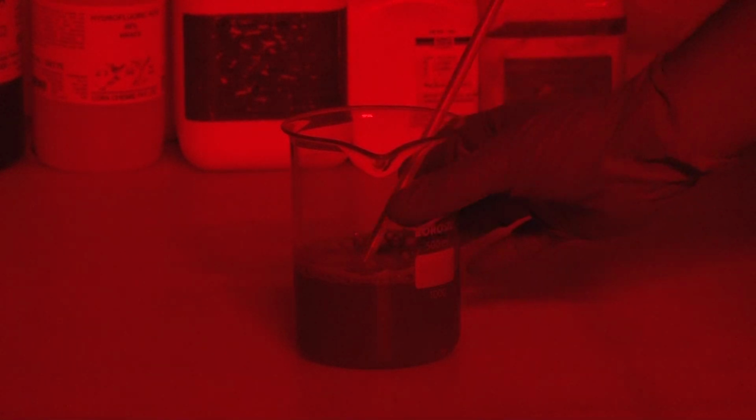You have to stir your sample after pouring the HCl. As long as your sample is giving effervescence, you have to keep it for a longer time. And when you cannot see effervescence coming out from the sample, that means all the carbonate has been dissolved. Once your carbonate has been dissolved, you have to wash out this sample with distilled water.